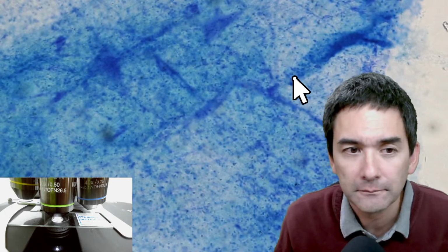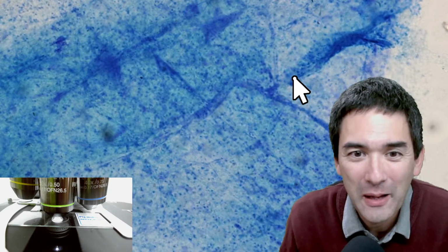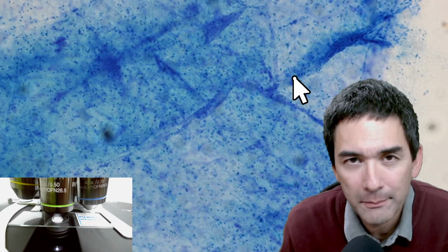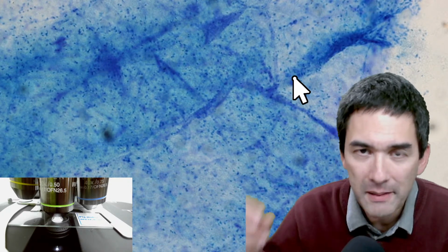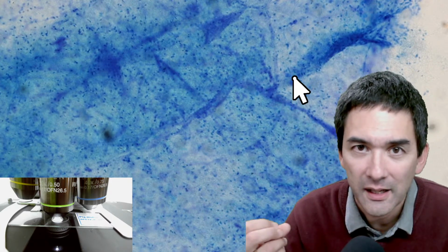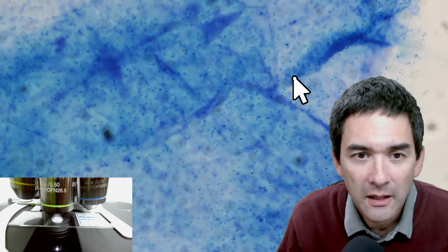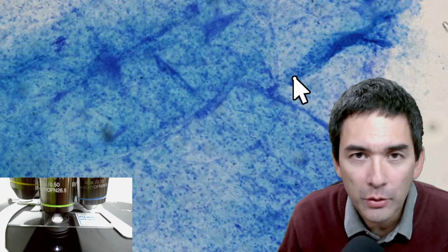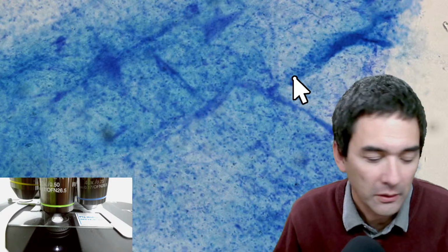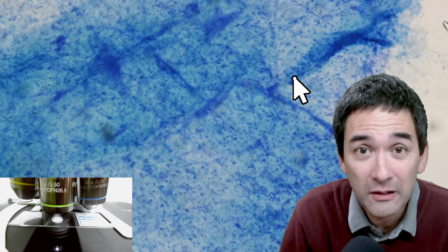So would I buy them? Why not? If you want to have them. I don't know if you were to buy them primarily for the specimen, or do you want to buy them primarily because you want to collect antique slides? So I think that is the question. If I'm in education as a teacher and I want to do microscopy with a whole classroom where you look at different specimens, I need a large number of slides, which basically are very similar.